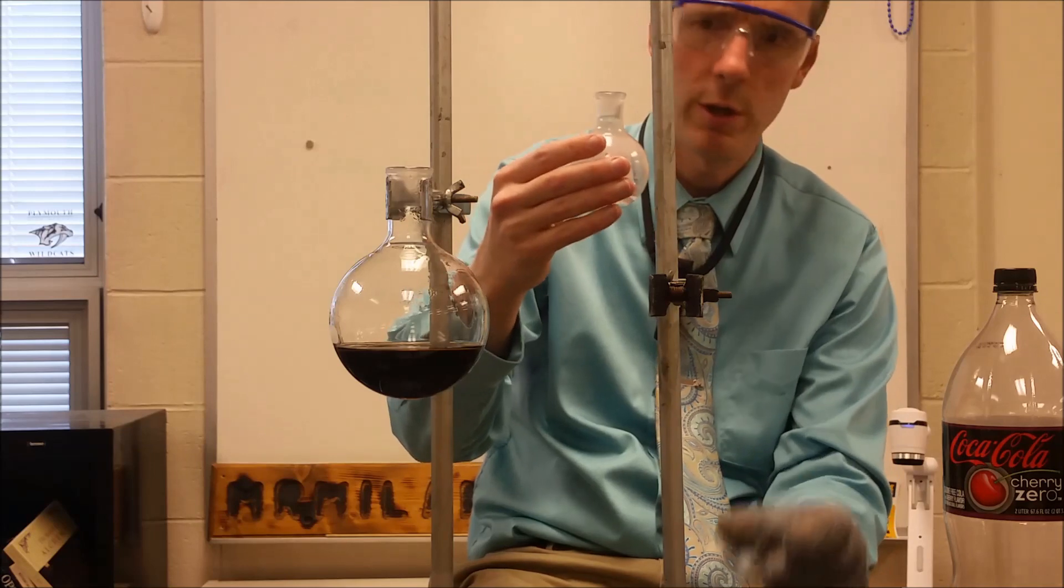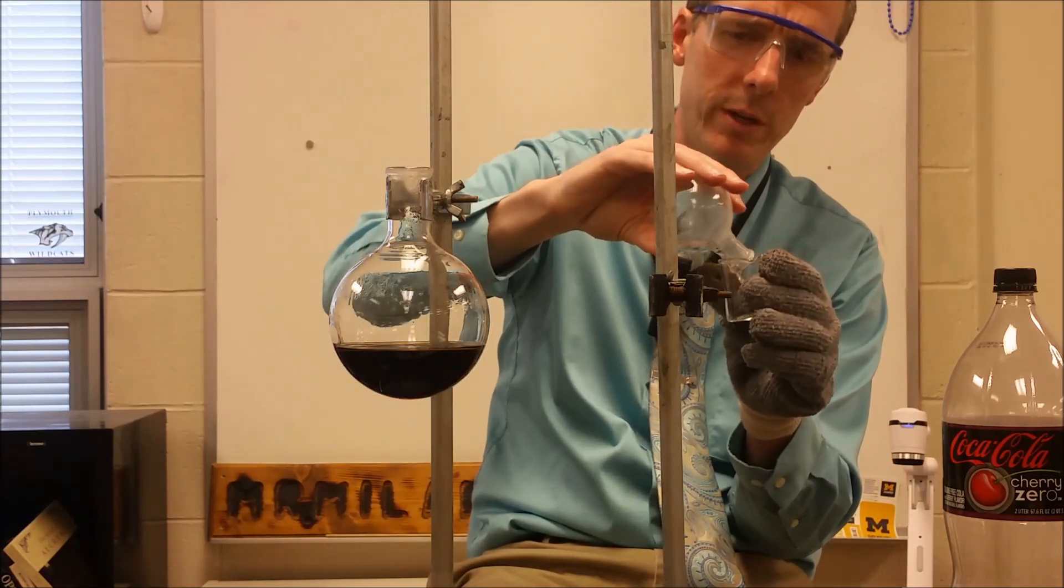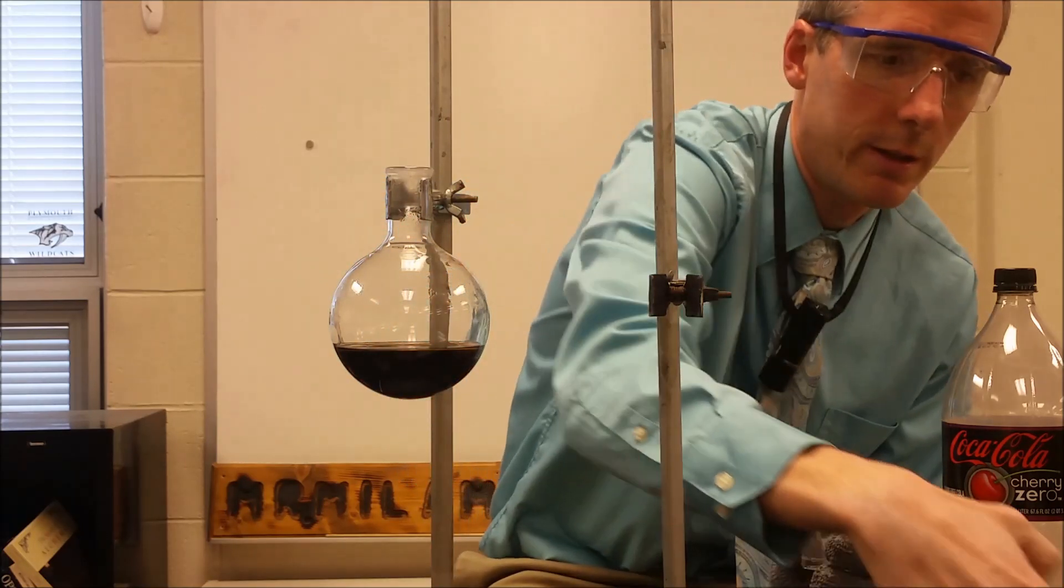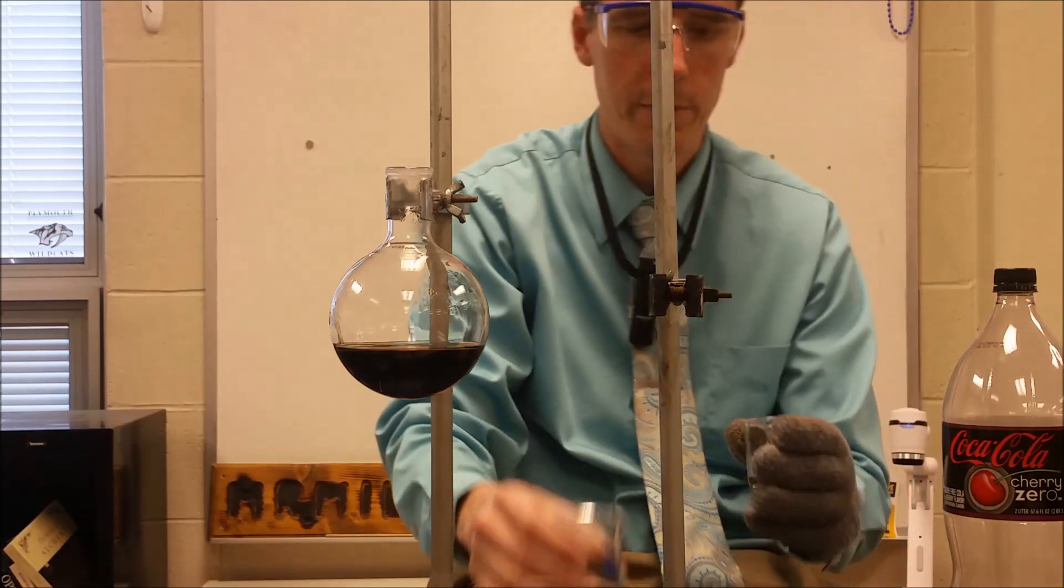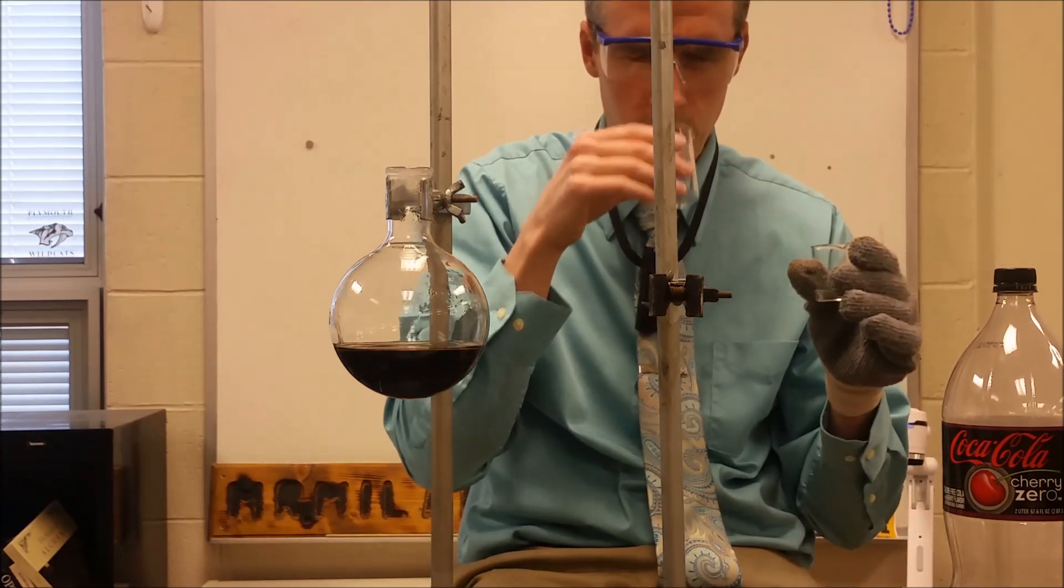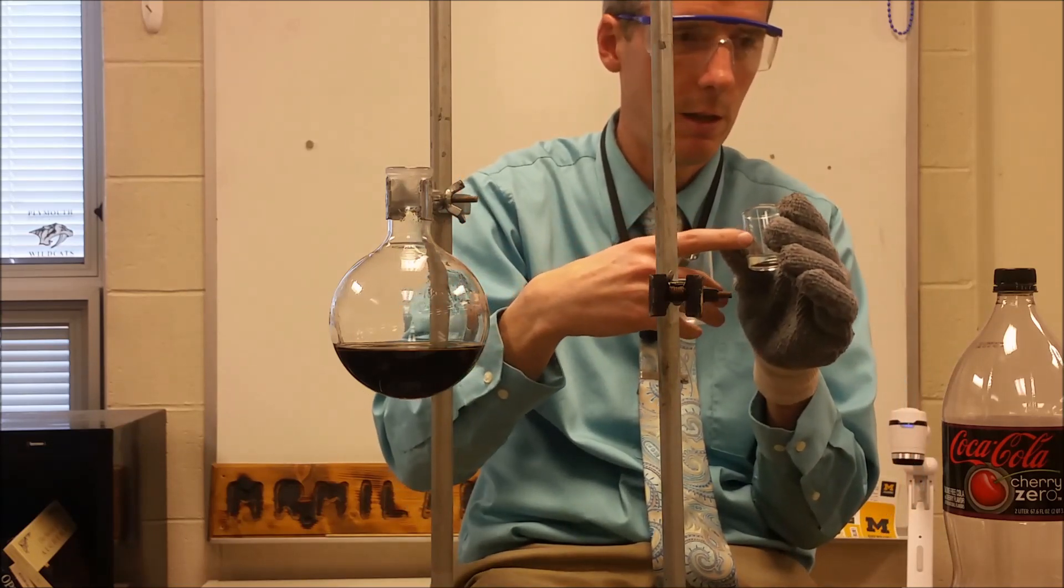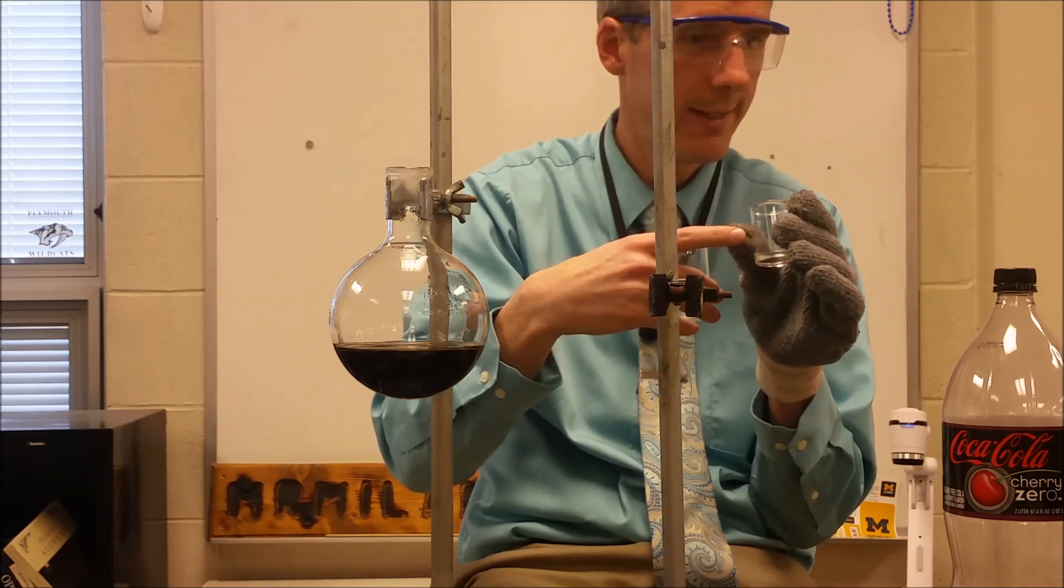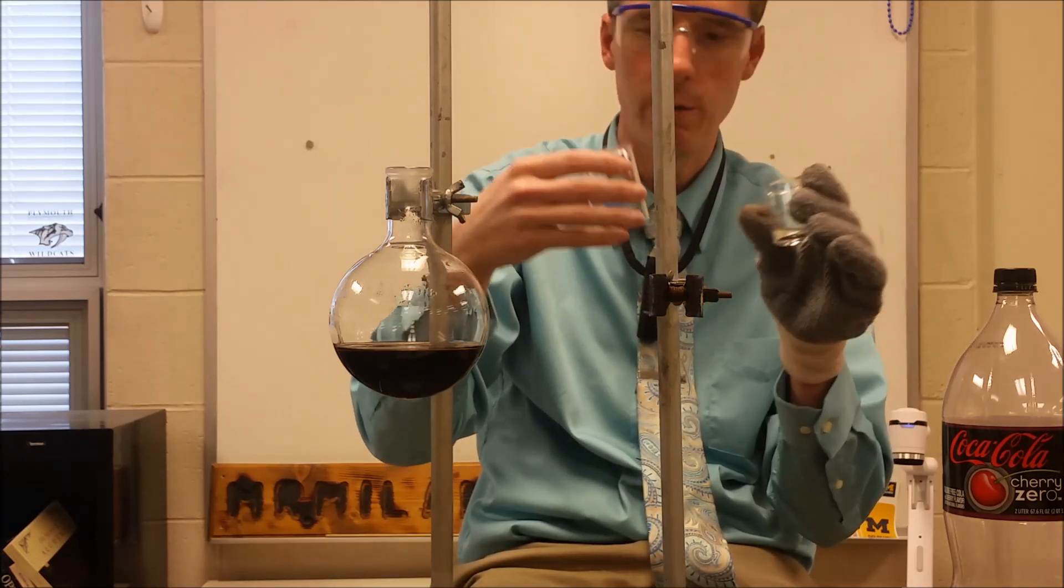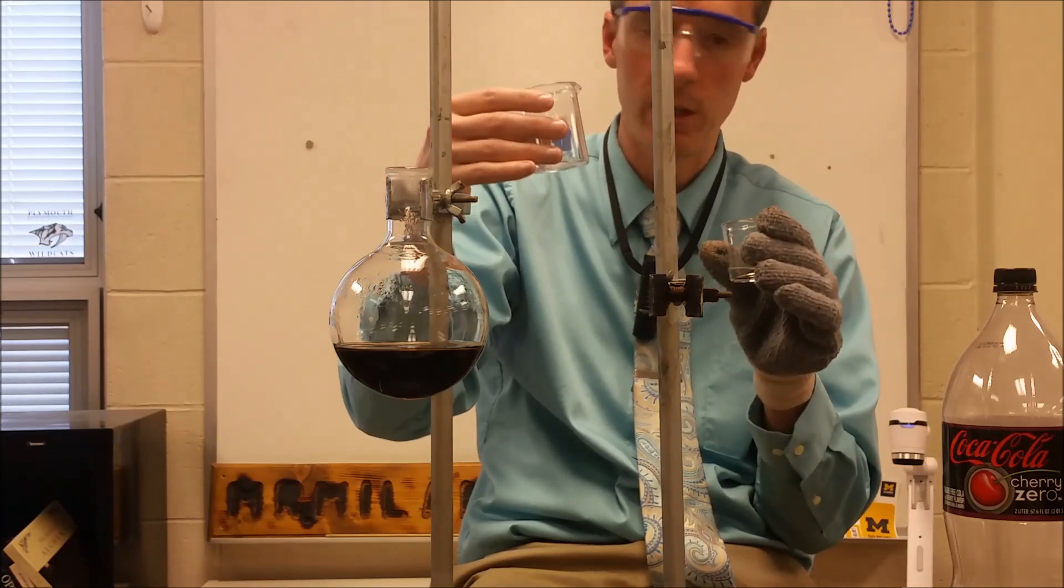So here's our cherry Coke regular. I'm going to pour it into a beaker so I get a similar surface to draw that scent from. I'm going to set this down on the glove so nothing bad happens. So very, very similar smell comparing the two. So it appears that the cherry Coke has the exact same cherry flavoring or whatever chemicals added to give it cherry flavoring that the Coke Cherry Zero had with it.